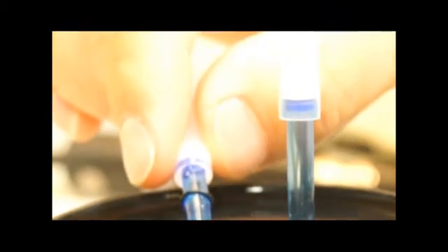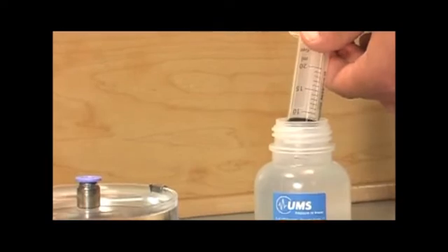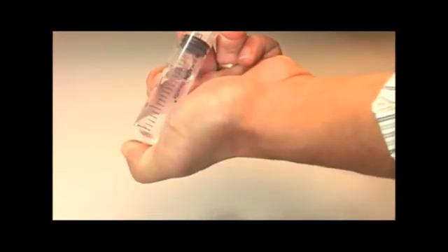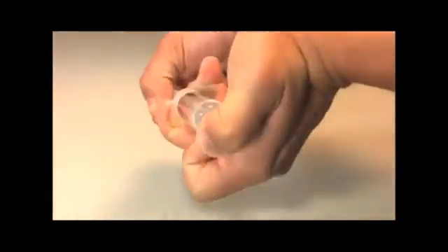The key to the rest of the preparation is ensuring that all dissolved air is removed from your water. To do this, plug the syringe with your thumb and apply a vacuum. You can see air bubbles form in the water. Shake, flick, and roll the syringe to let the air bubbles escape.